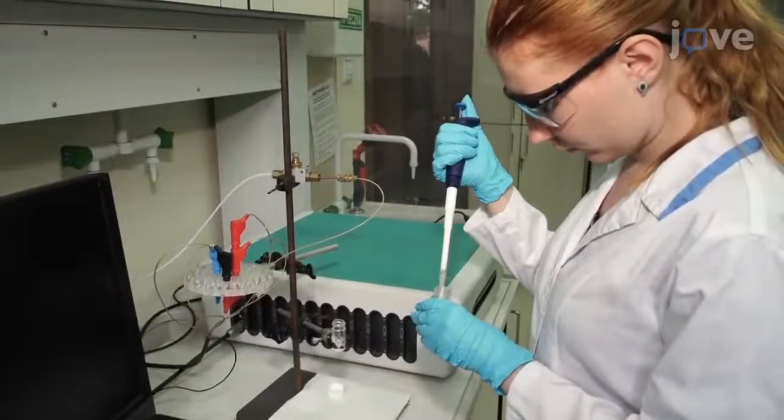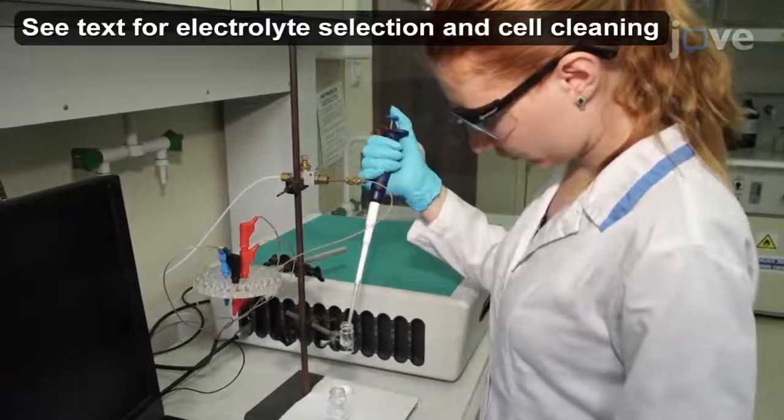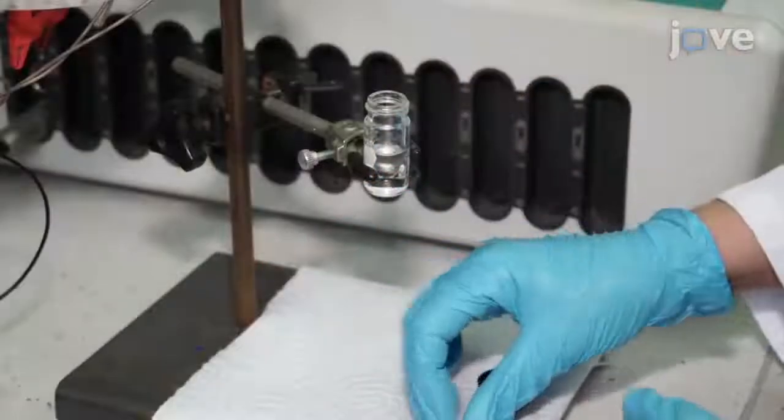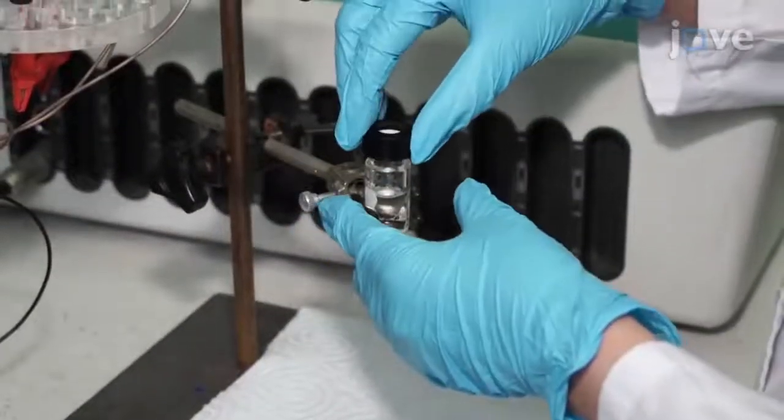To begin the CV procedure, fill a clean electrochemical cell with 1.5 milliliters of electrolyte solution and cap the cell with a polytetrafluoroethylene electrode holder.